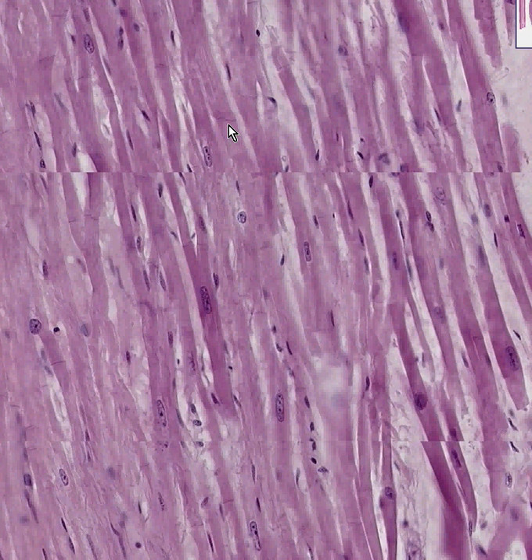So there we are, all three types of muscle on one nice slide. And I hope that I can convince you that there's no possible way you could ever confuse skeletal from cardiac muscle for the rest of your life.